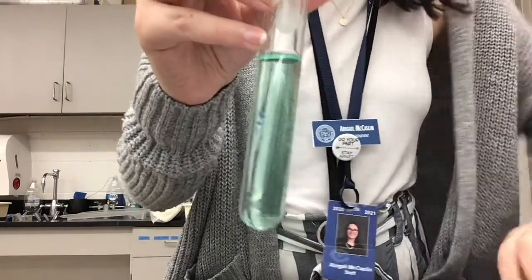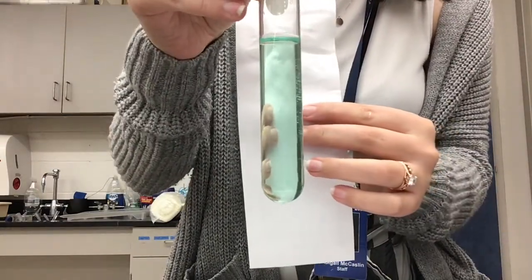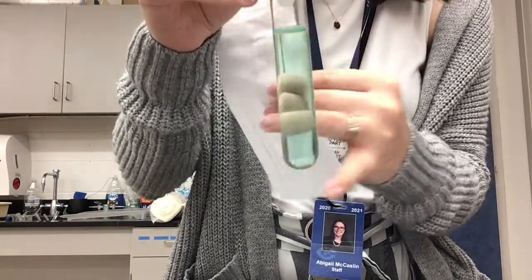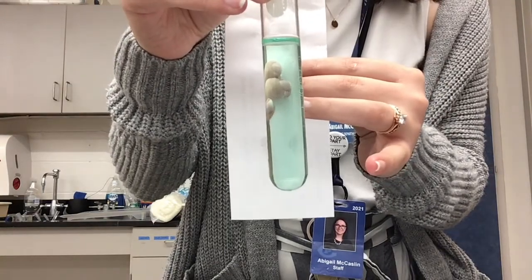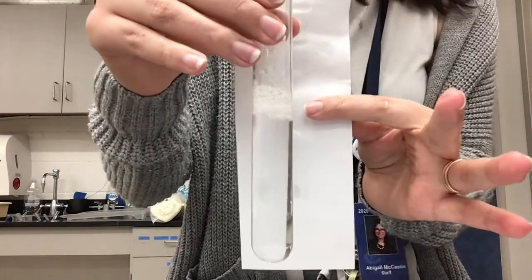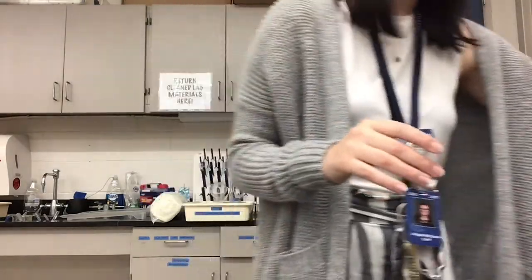Time-lapse sped things up for you, but it has been 2 minutes of shaking. So now we're going to compare the solubility between my ionic compound and my covalent or molecular compound. Here we go, this is my ionic compound. Before, I had it filled with water and I could see the blue on the bottom, but now I don't really see that. The second one is our molecular compound. Again, I still have this white in the beginning. So make observations on your handout about the solubility between these.